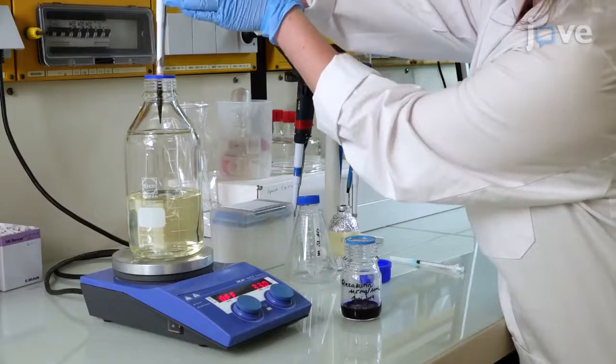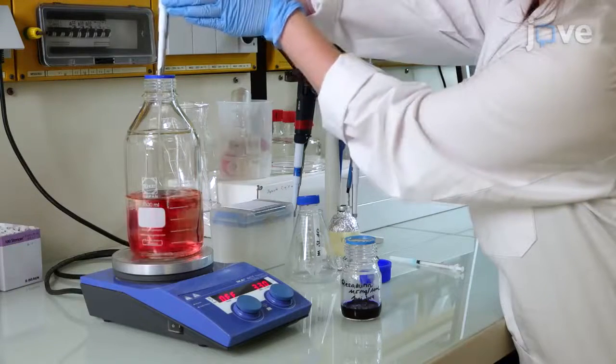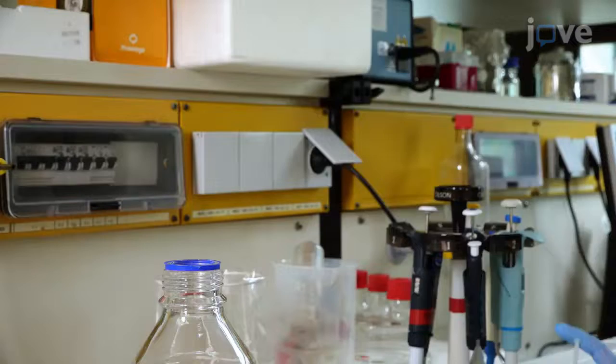Add 1 ml of redox indicator, followed by vitamins and trace element solution.